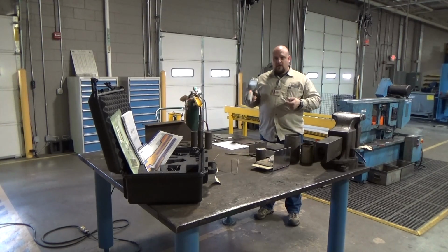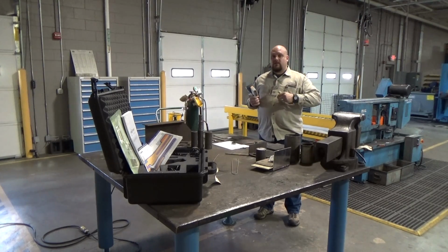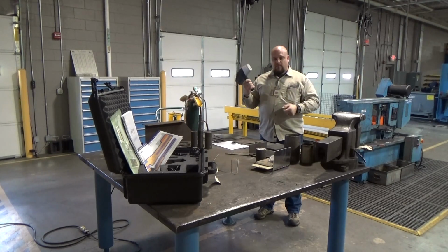What material is coming in? What scrap weight do we need to pay for this item? Is it what they say it is? So, and then we also find it being a very big part of quality assurance. Raw materials coming into a production facility. You pay for 304 stainless steel. You want to ensure that's what you get. More than just paperwork, you want to verify physically.